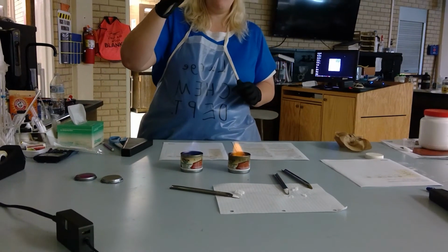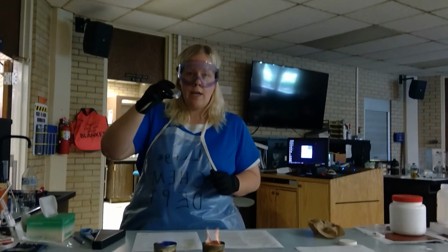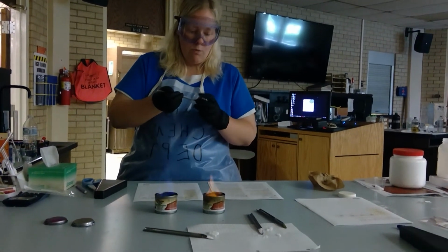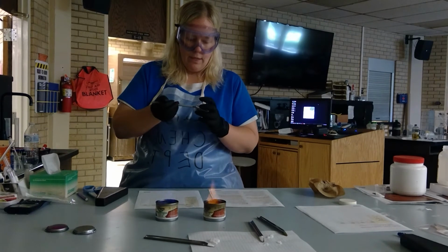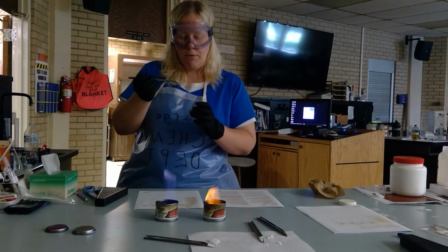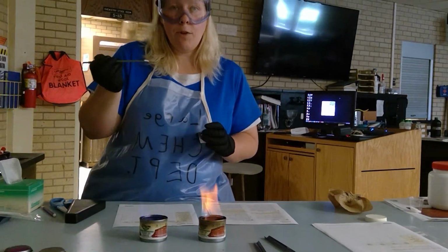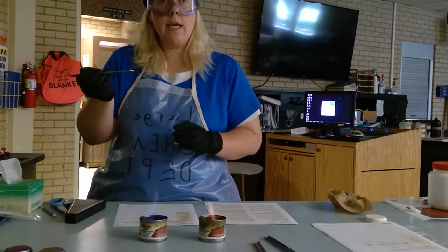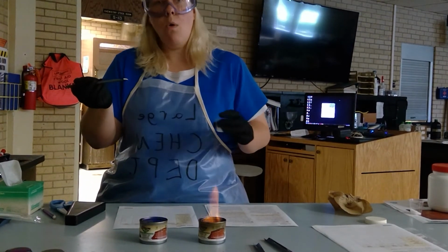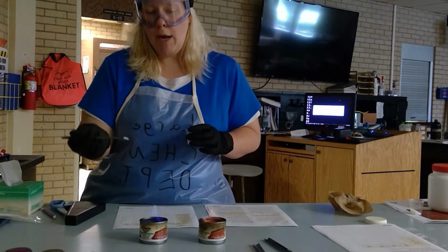And if you were watching carefully, that would eliminate one of the samples already. But I'm going to take this white solid, and this is your unknown. So based on your observations from what we just did earlier, you can take this flame color and say the unknown is potassium chloride, or is it sodium chloride. The flame color should match.